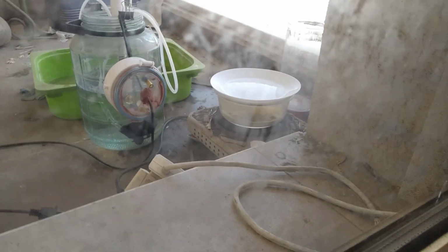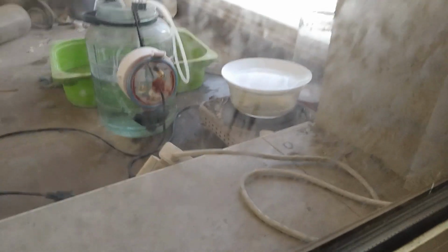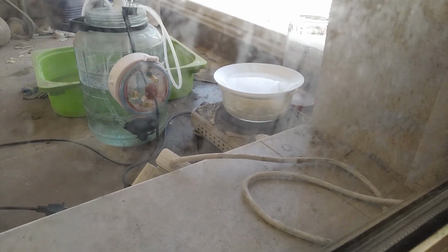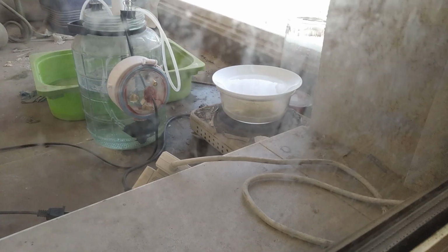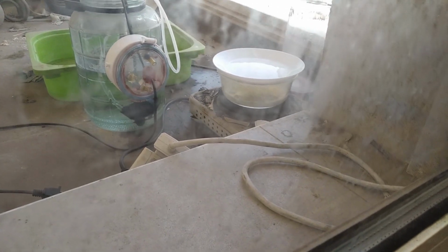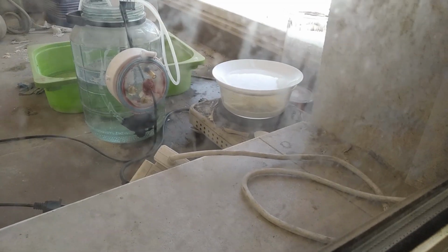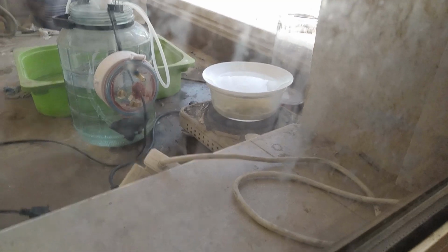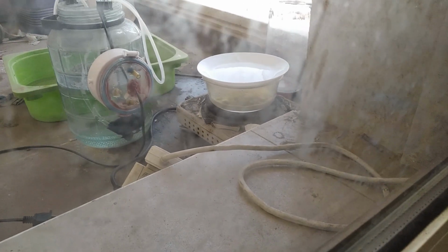So over here, I'm dissolving tin lead alloy in nitric acid. And I'm not going to open this door until this reaction is done. That metastannic acid should precipitate out and can be filtered. Anyway, looks like the acid I've extracted is pretty good, because right now I've shut off the heating because the reaction seems to have gone crazy over there.